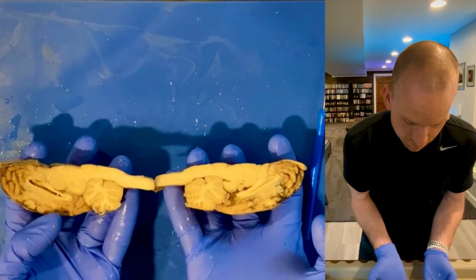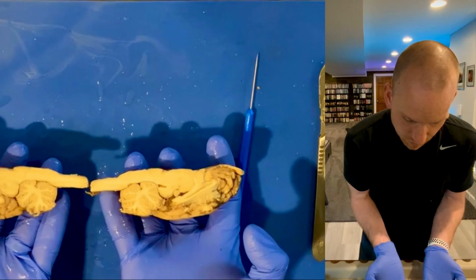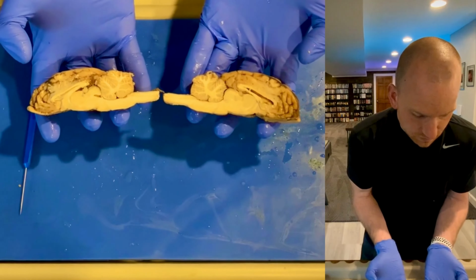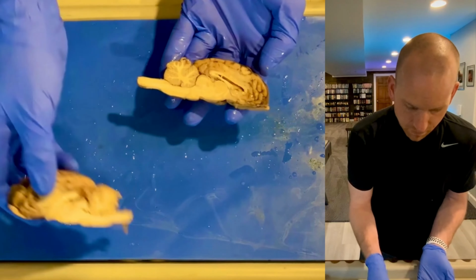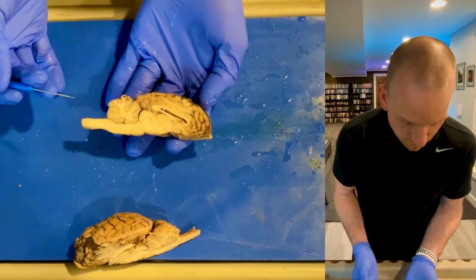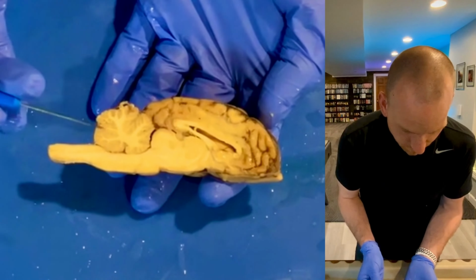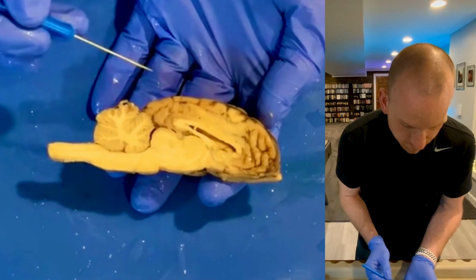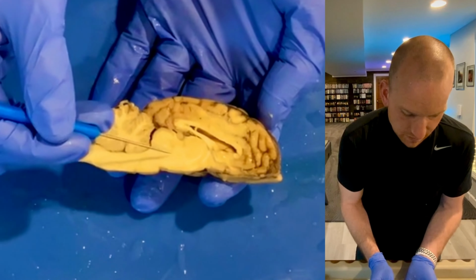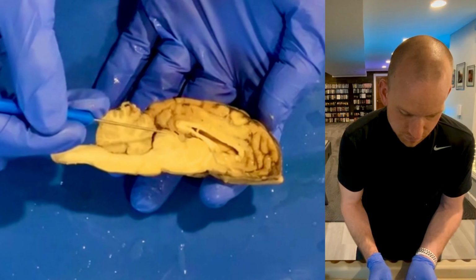So actually this does look pretty good opened up. It looks pretty symmetric. I think there probably still are a couple spots on the other one that might be a little bit more visible, but I think I can show you here. So, structures when we're looking inside that I do want you to know about. First of all, we talked about the midbrain before. The midbrain is still found right here. So this section right here is midbrain.